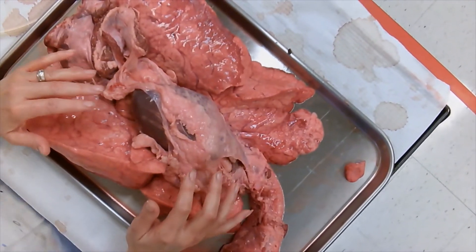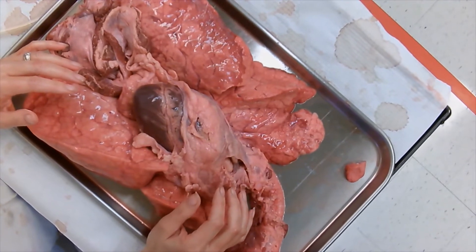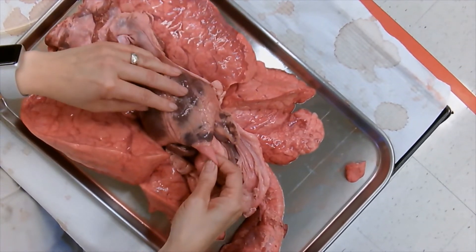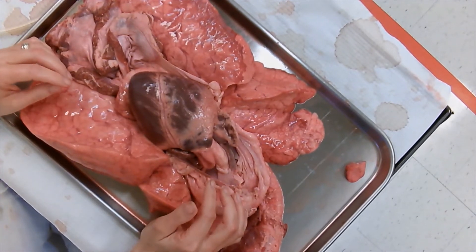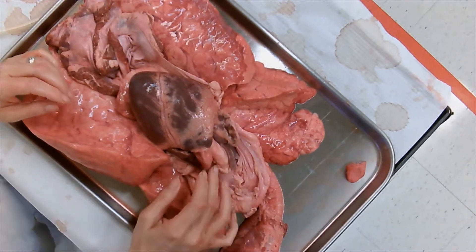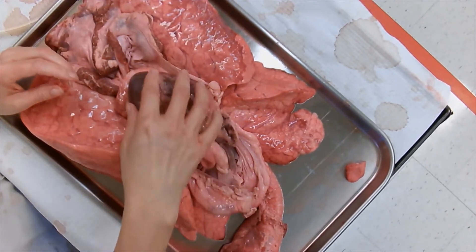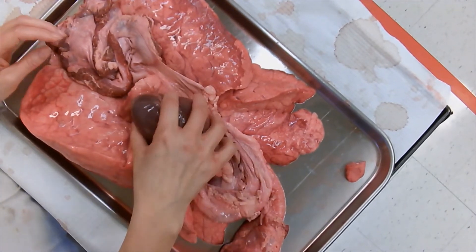Can you show us the pulmonary artery? Right there — the artery goes to the lungs. And if you cut the aorta, that main artery that goes down — you got the right idea. The aorta and pulmonary artery are different vessels.